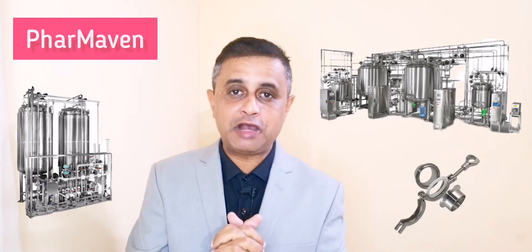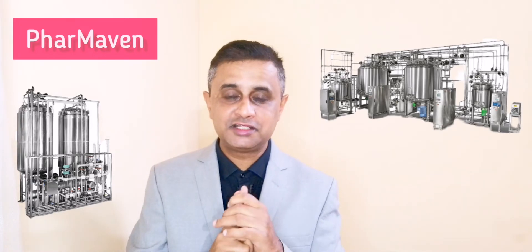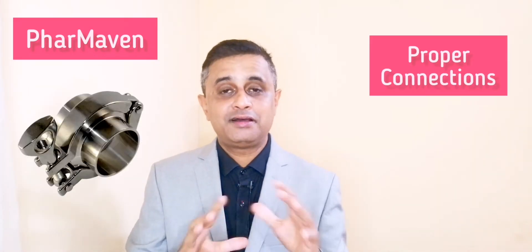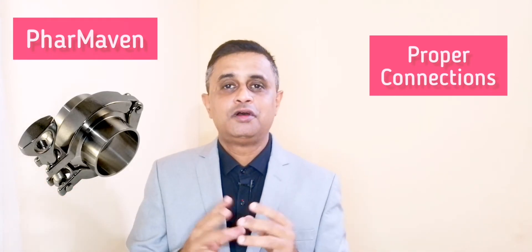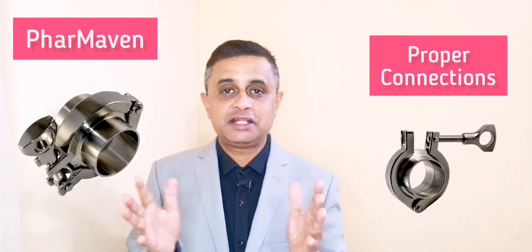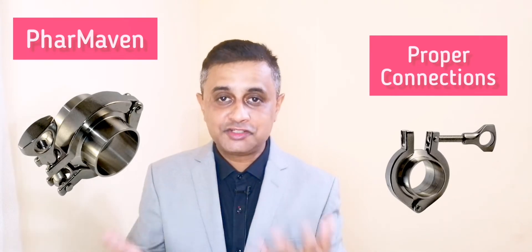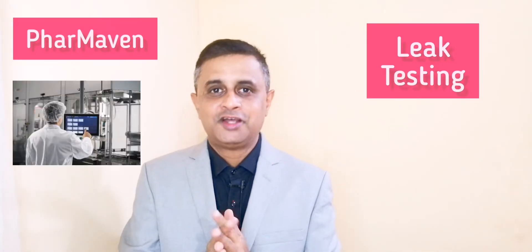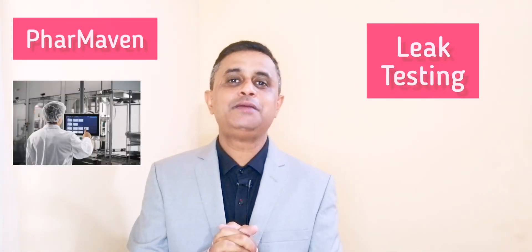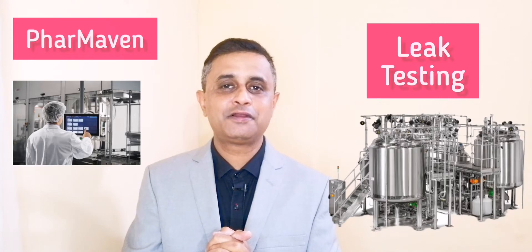In this video I will cover three important points: one is proper connections, two is ensuring each and every gasket and connection is checked for tightness before you proceed with the media fill, and third is the leak test. These are three important aspects when performing a media fill for a complex manufacturing system involving multiple vessels.